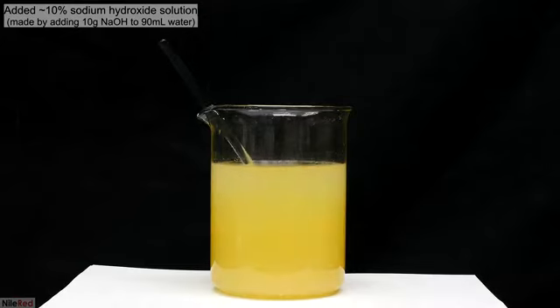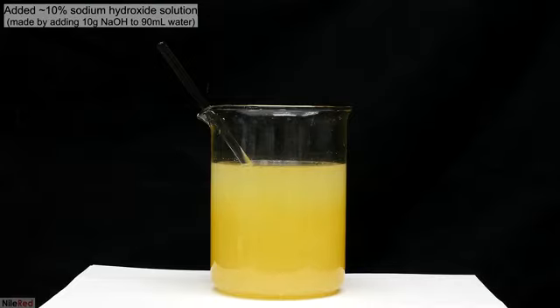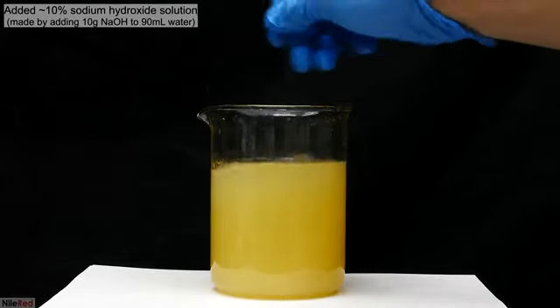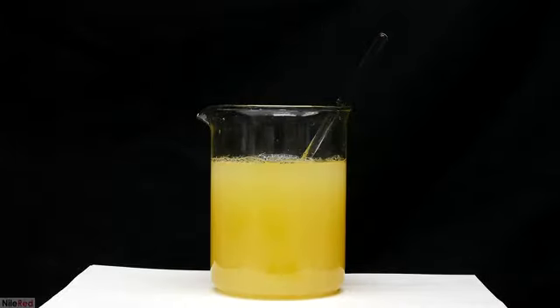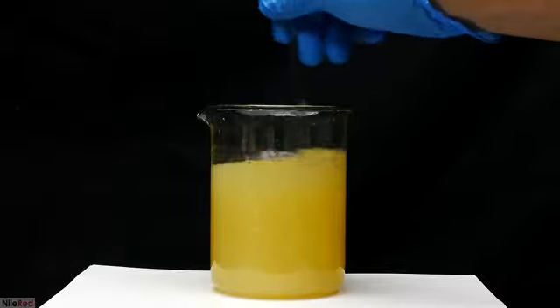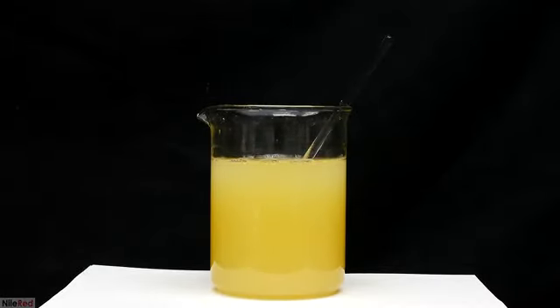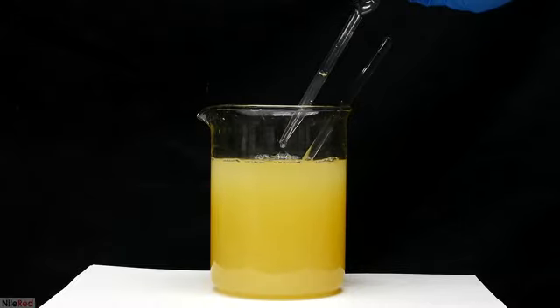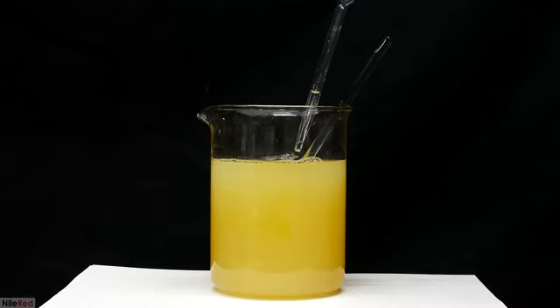A glass stir rod is added to the beaker, and then I start to add sodium hydroxide solution. The sodium hydroxide solution is 10% by weight, and I'm not exactly sure how much I added. The goal here is to add the sodium hydroxide solution slowly until we reach a pH of about 8 or 9. Initially, when the sodium hydroxide is added, it won't look like too much is happening, but a very distinct color change will eventually occur.